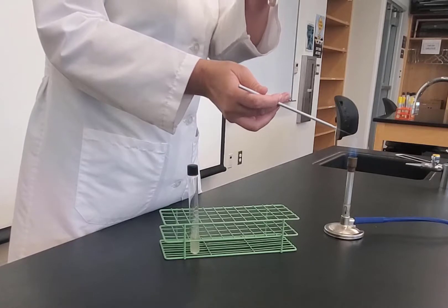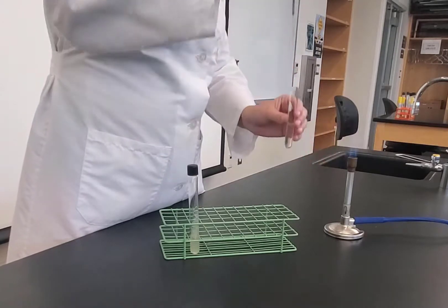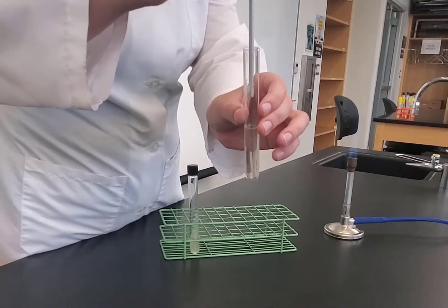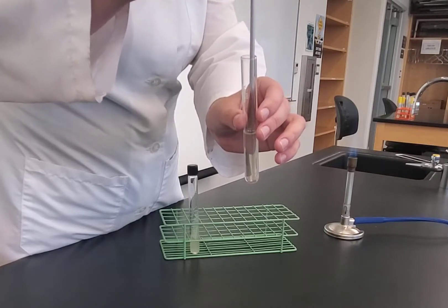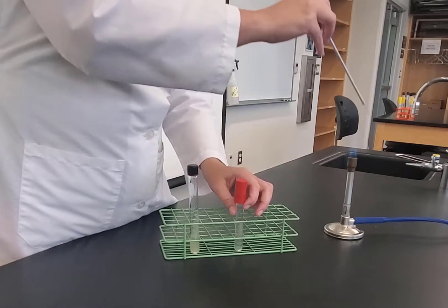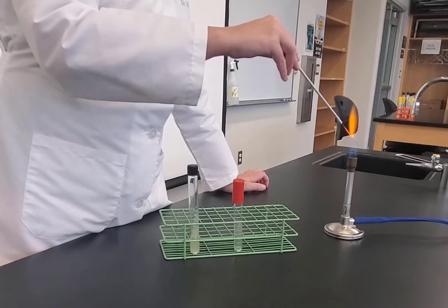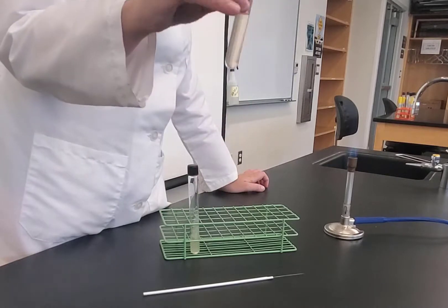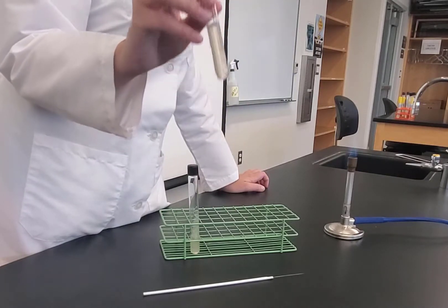Now I need to stab inoculate this too. I'm going to take the cap with my pinky and ring finger, and I'm going to stab. I'm going to go about one centimeter from the bottom, and I'm going to come straight back out, flame it, cap, and then flame my needle. I would do this for all four organisms, and then I would put them in the incubator and incubate for 48 hours.